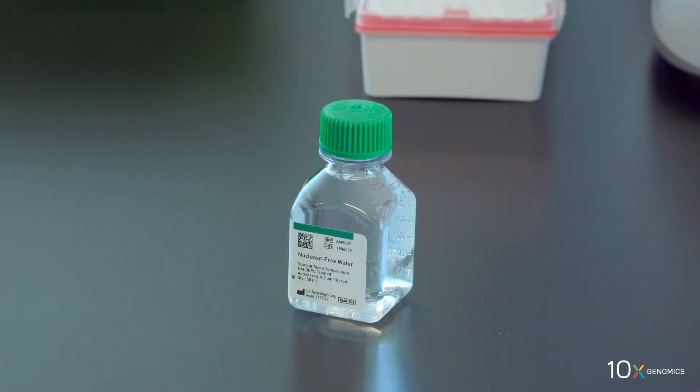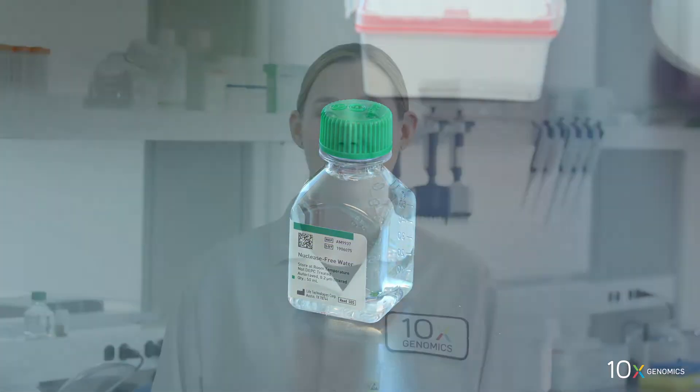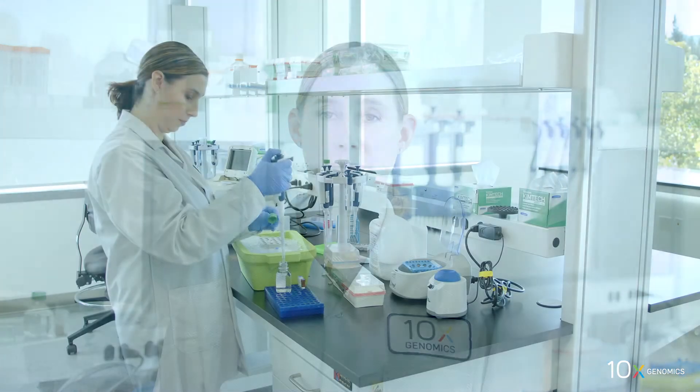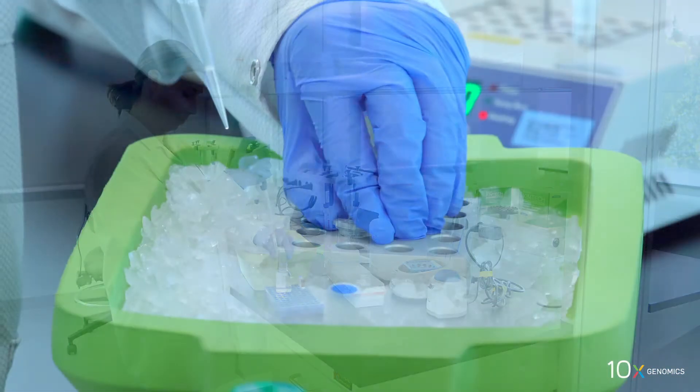Finally, we have nuclease-free water. Next, we will prepare the fluorescent RT MasterMix on ice. We will add the reagents in the order listed in the user guide. First, we add nuclease-free water.